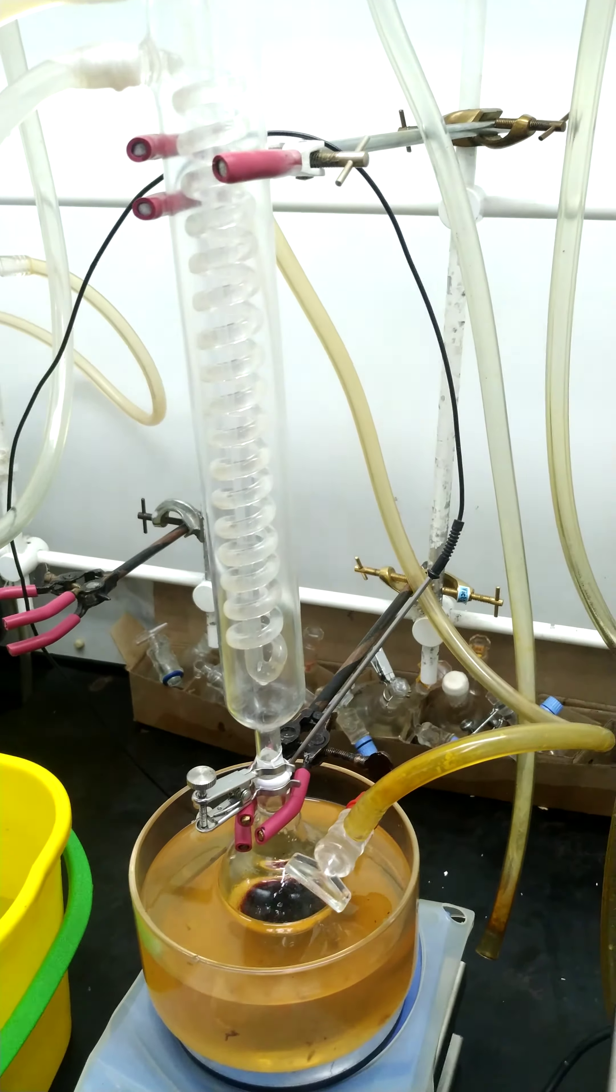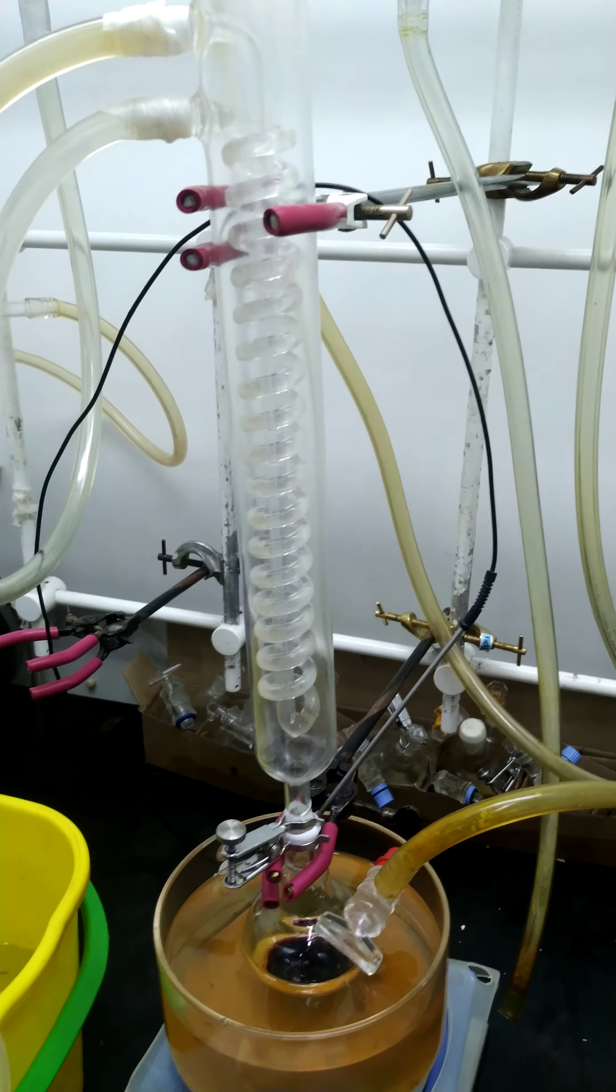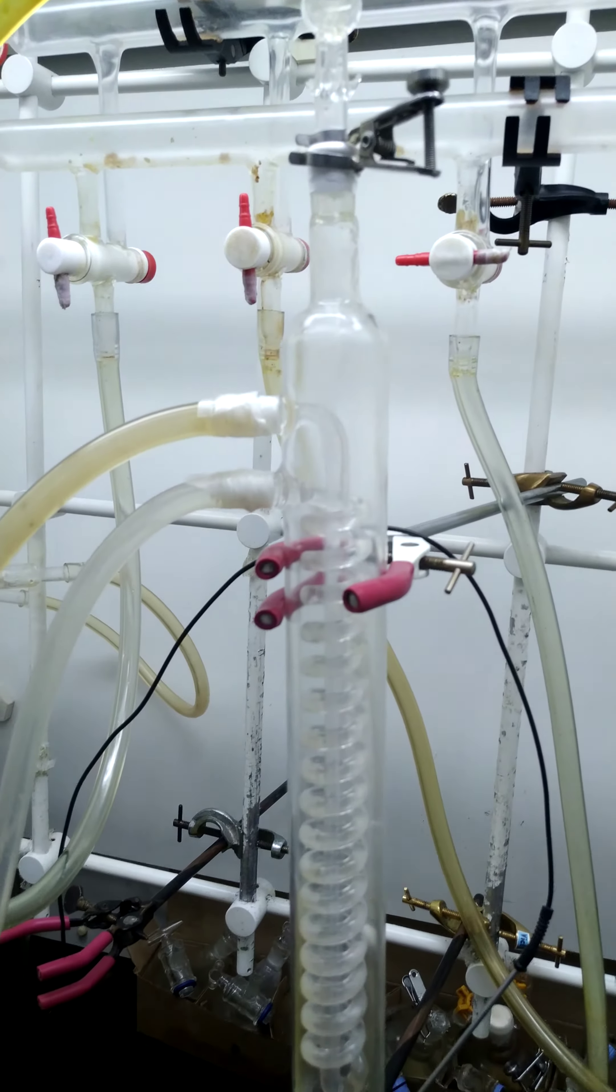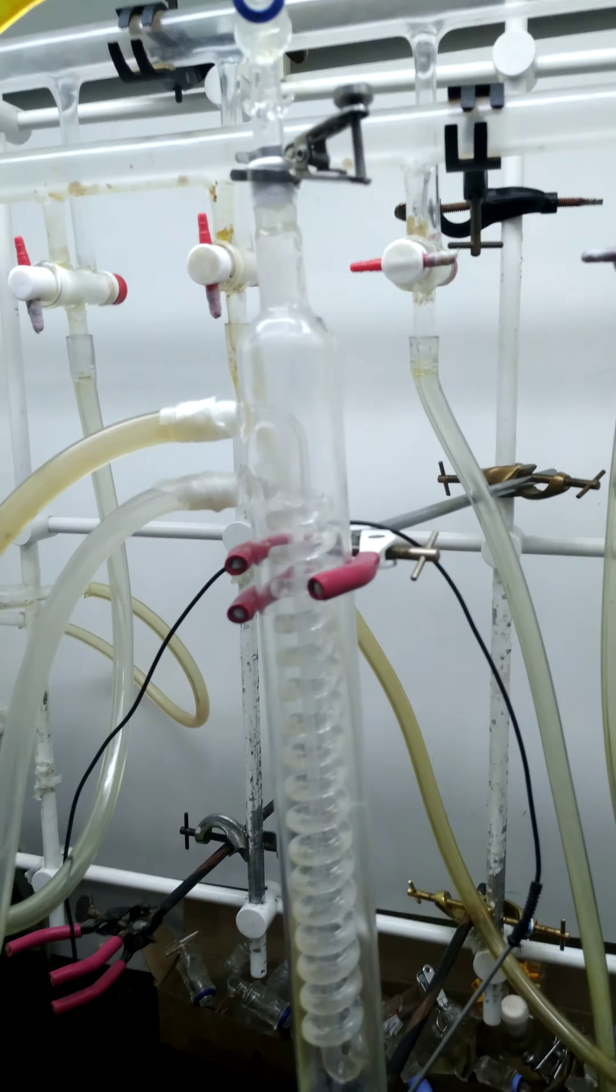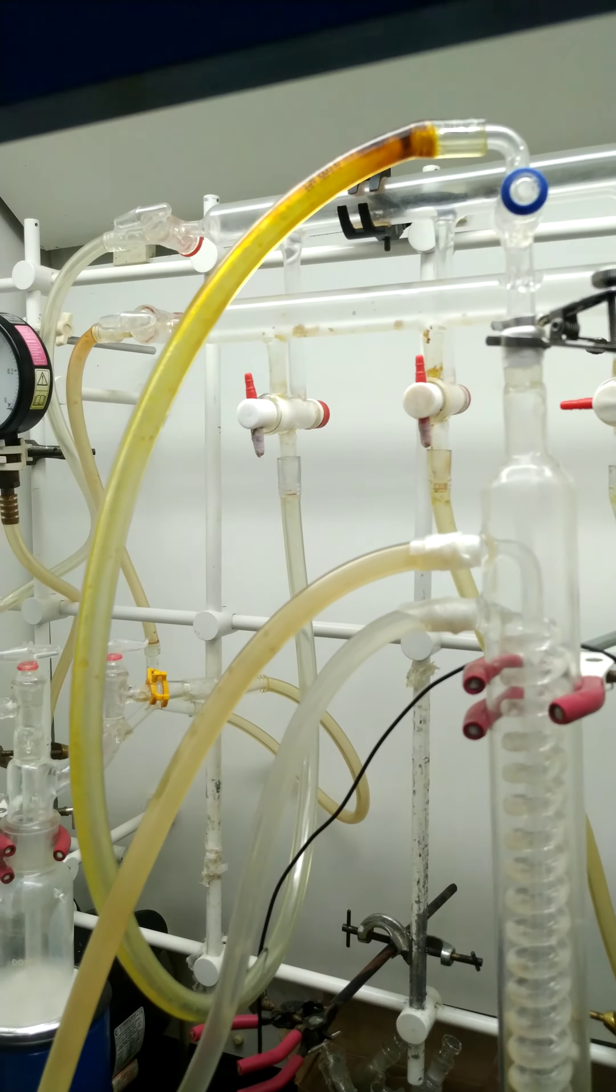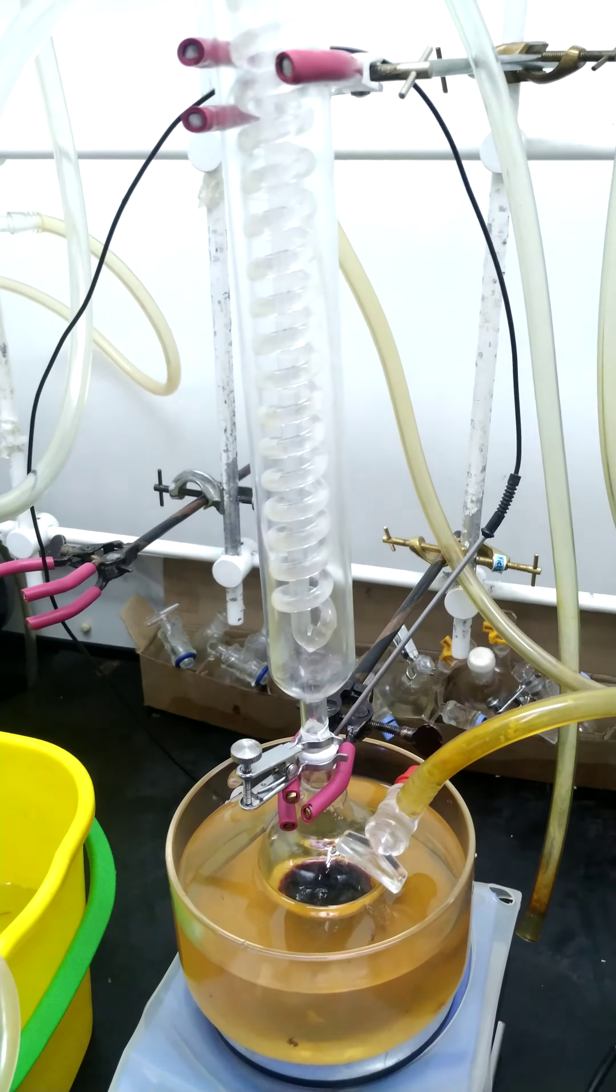Hello guys, today I am going to demonstrate what a reflux reaction is. You can see I am doing a reflux reaction. Basically, we heat the reaction mixture at the boiling point of the solvent, which is the reaction medium. The solvent gets vaporized and goes to the condenser.